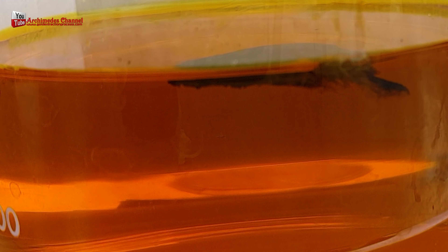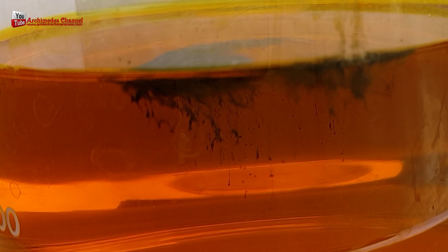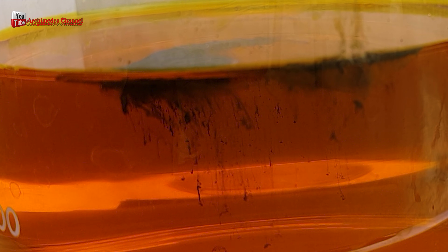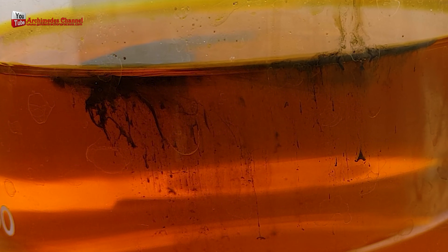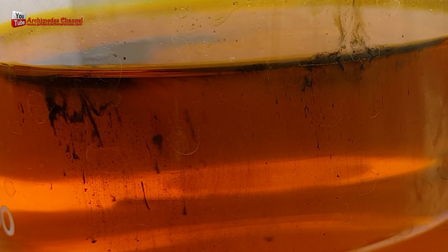I will show you the amazing change of gold mud. Use sodium metabisulfate mixed with water, slowly added to the gold solution. You will see the formation of gold mud. Precipitated gold particles vary in size, but tend to be small and float easily in the rinse water.